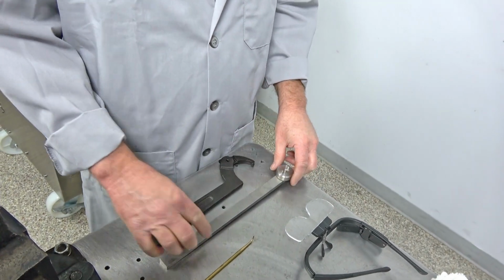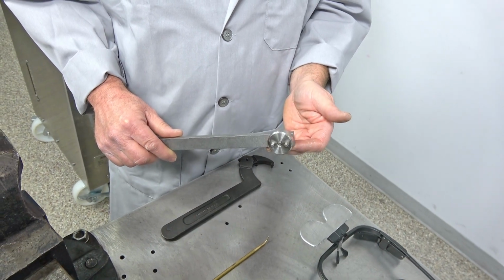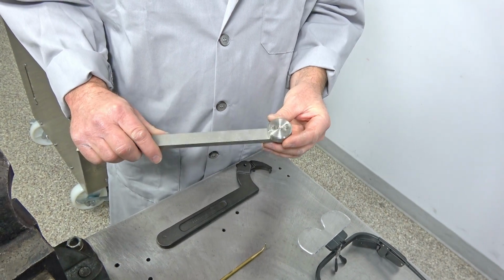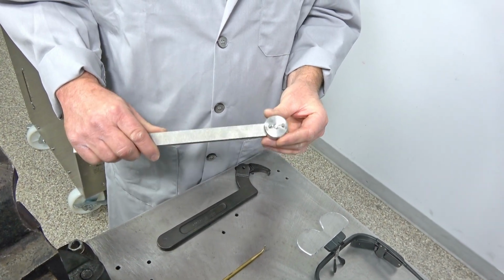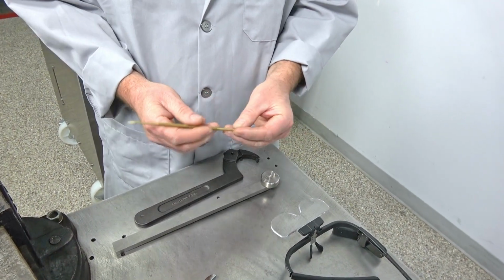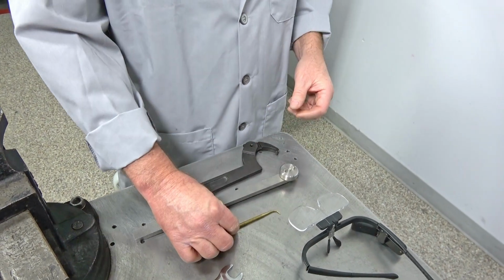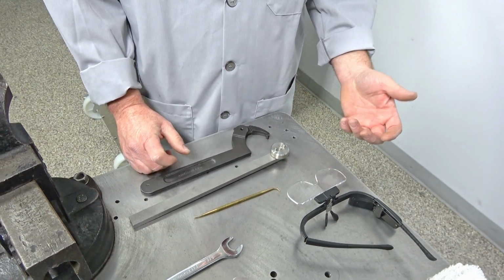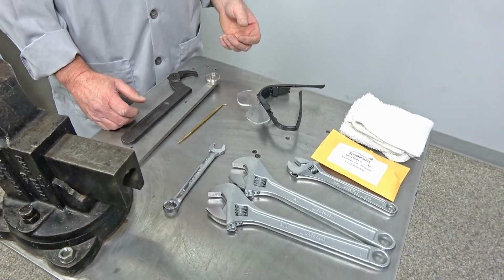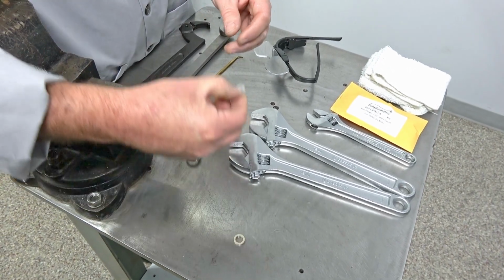And then this is kind of a specialty tool spanner wrench, and this is one that I believe Microfluidics makes, but we're going to show you how it works. And then I have a brass pick here, which we're going to use to pick the seal out, because we've got to dig down in. So these are the tools we need. Not a whole lot here. I also have my magnifying glasses for when I get down and want to look at the seal and evaluate the damage on everything.